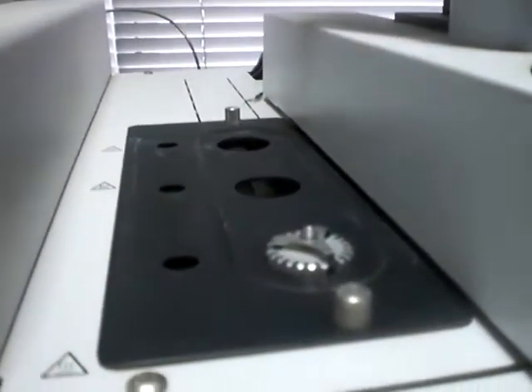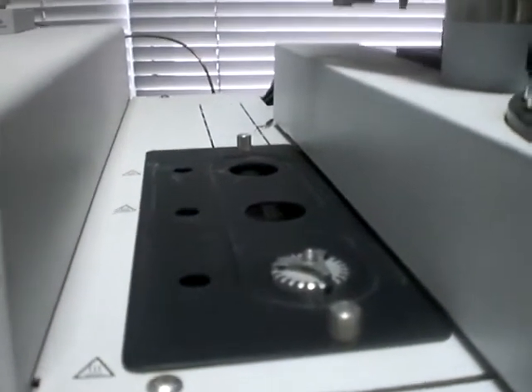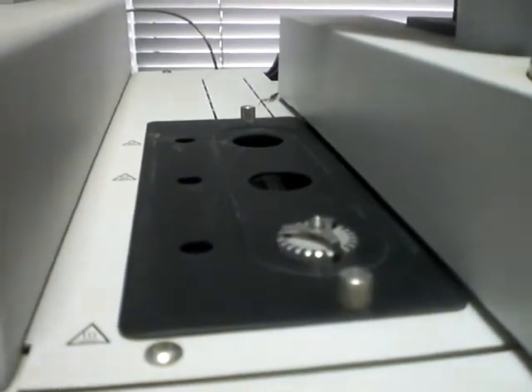You will see now how the autosampler will inject a certain volume from our vial into the injector here, and the solution will go to the column to be separated. Then it will go to the detector part here. This is the MS part. The mass spectrometer will detect the material. Okay.